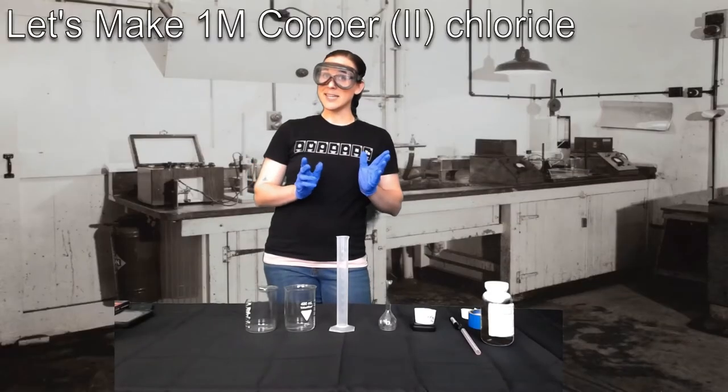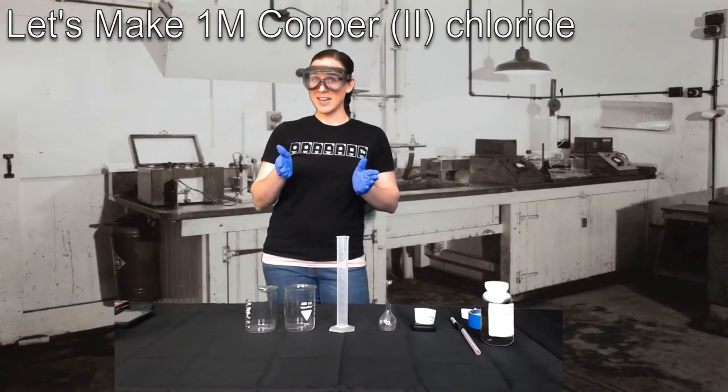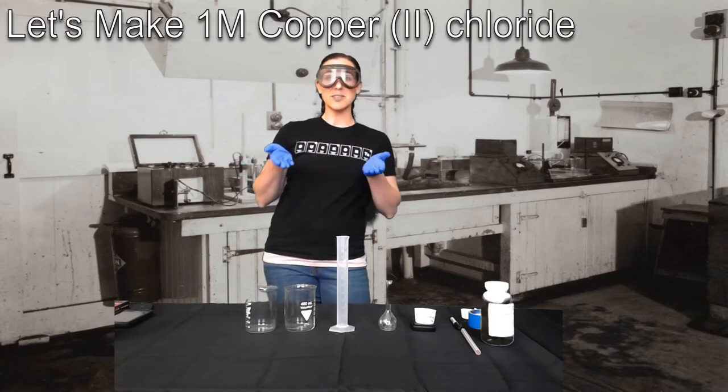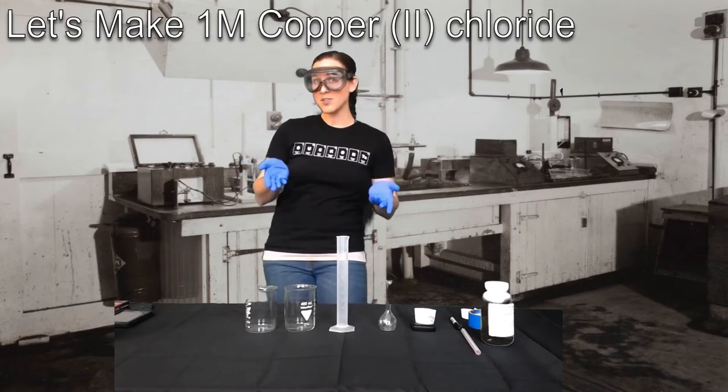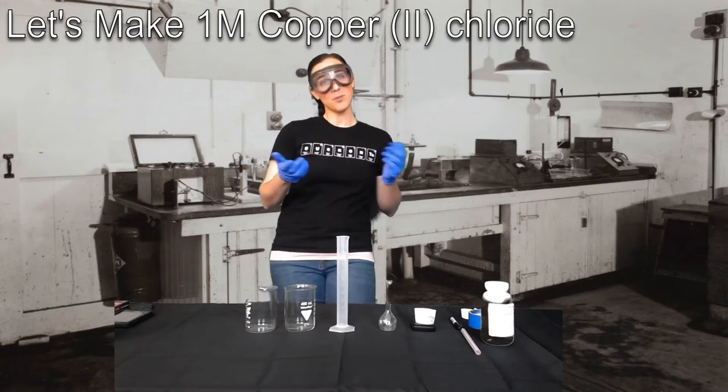Now my little mini scale doesn't go to the second and the third decimal place. So we'll just have to deal with 7.9 grams of CuCl2 and hope that we're close enough.